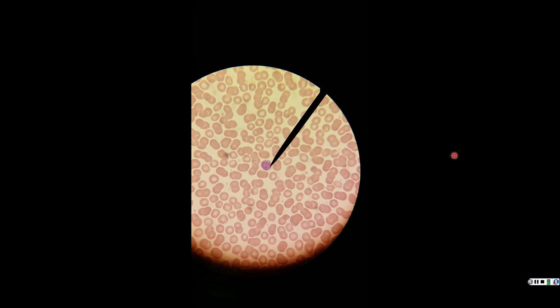But after neutrophils, the next most abundant is called a lymphocyte. A lymphocyte does not end in "-phil", it ends in "-cyte". So the cells that end in "-cyte", when we're looking at leukocytes, are agranulocytes. They do not have cytoplasmic granules. So when we see the nucleus, it's still going to have that purple, dark stained color. But the cytoplasm is going to be very, very faint, kind of a blue haze.